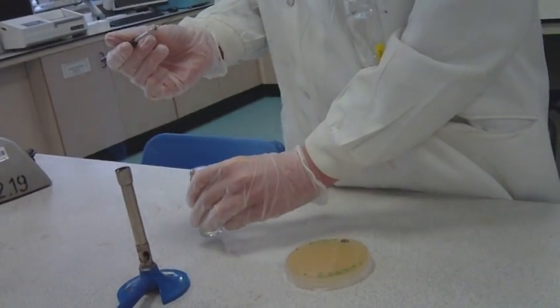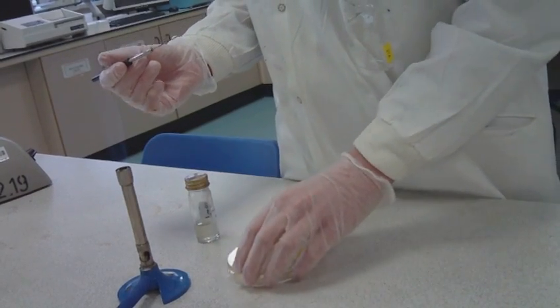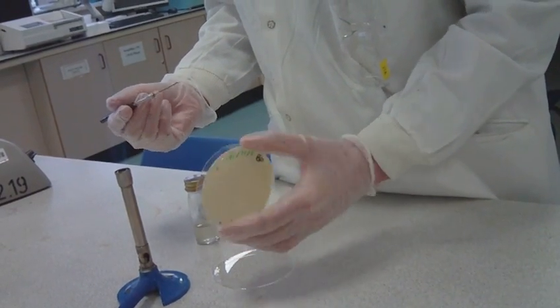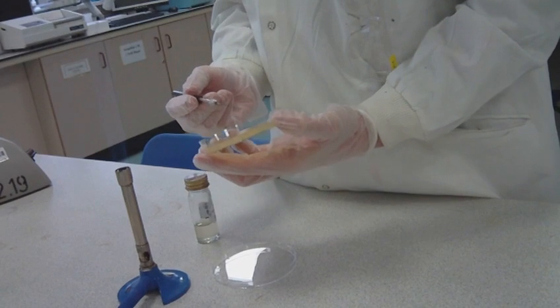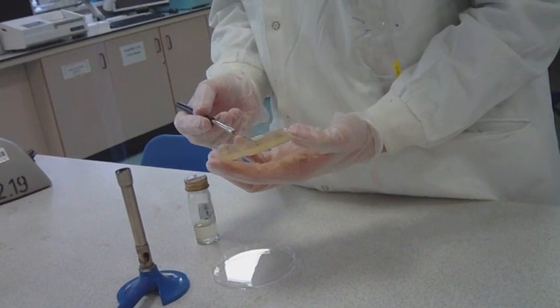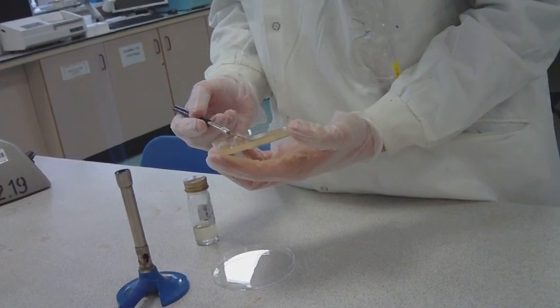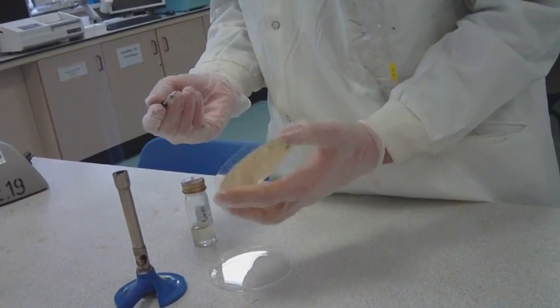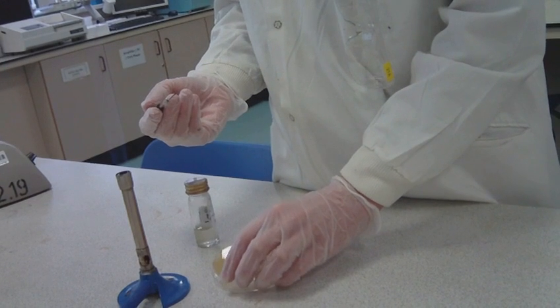Partially lift the lid of the petri dish containing the agar medium. Then, with the loop containing the bacteria, rub a small circle immediately and gently onto the agar at your first dot, 12 o'clock, to prevent the liquid from running down the agar.